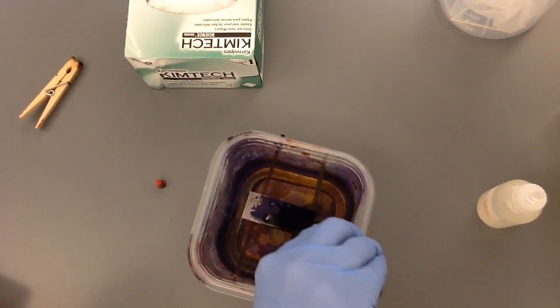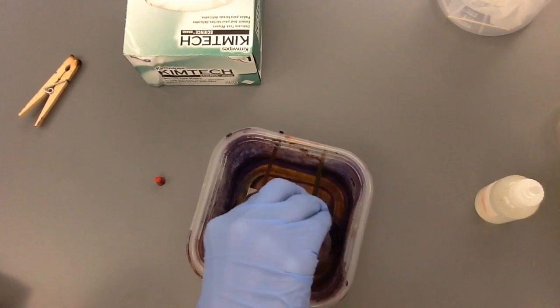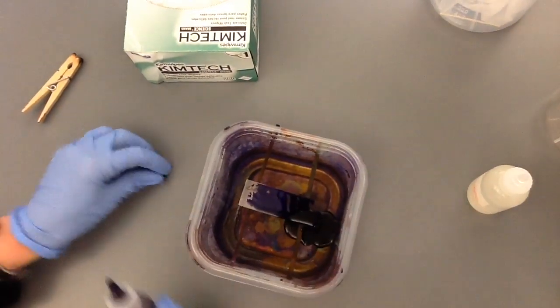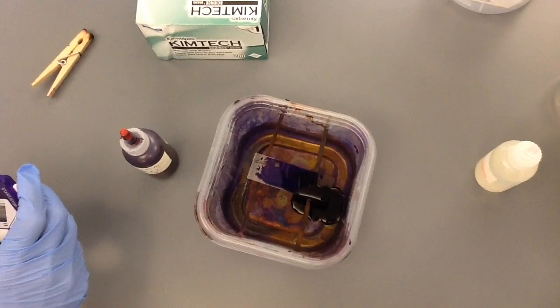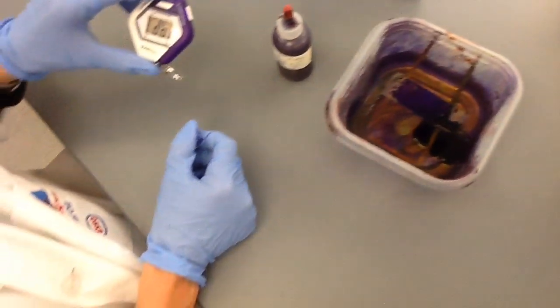Basically pooling the stain on the slide. As soon as you've covered the slide, you have time for 60 seconds.